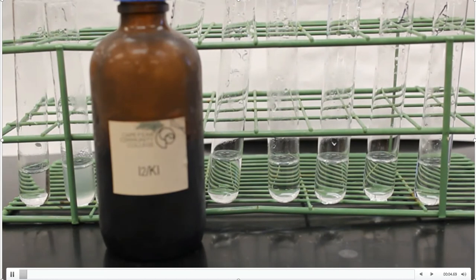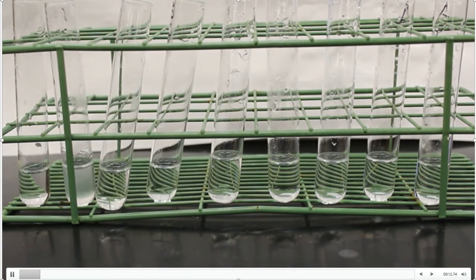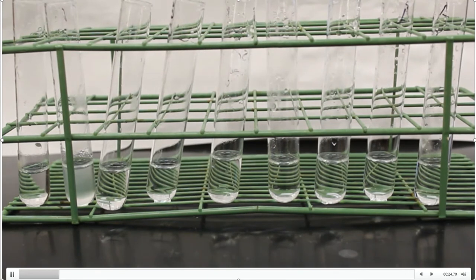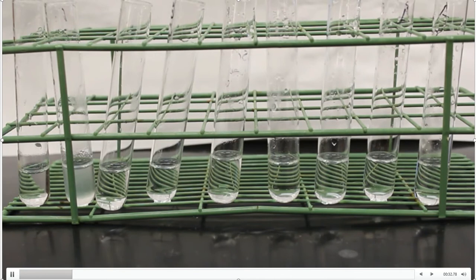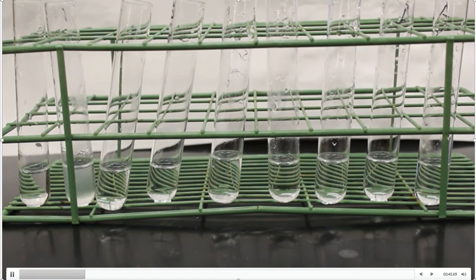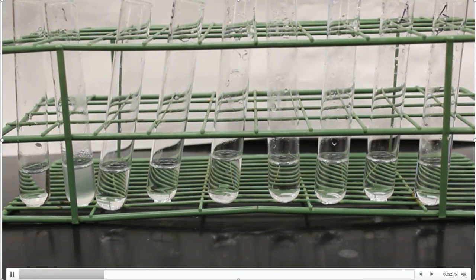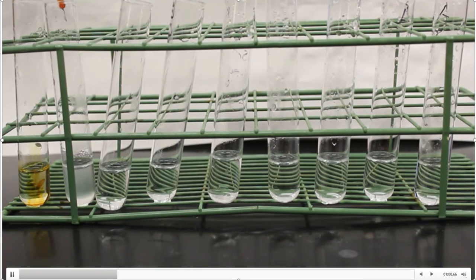This next test is the I2KI test, or the iodine test. That's what I have in the bottle here — the reagent I'm going to be adding to this series of test tubes to determine my observations. The I2KI test is basically a test for complex carbohydrates. A complex carbohydrate is something that has more than one sugar involved. So if there is a chain of sugars in these test tubes, I'll get a positive result. Otherwise, it's going to be regarded as a simple sugar — basically just one carbohydrate. The directions simply tell me to add a couple of drops into each test tube.